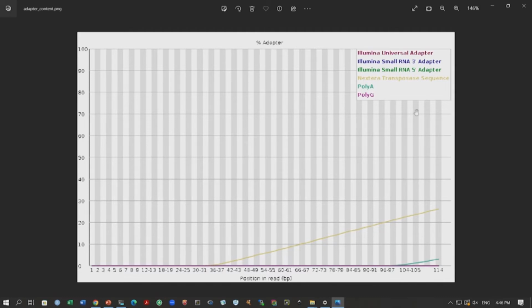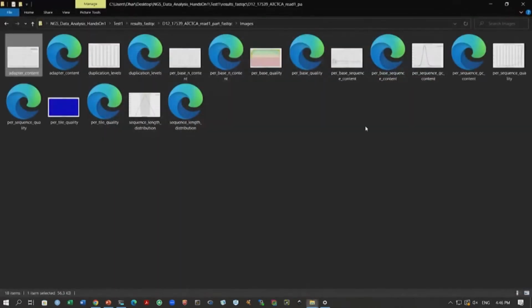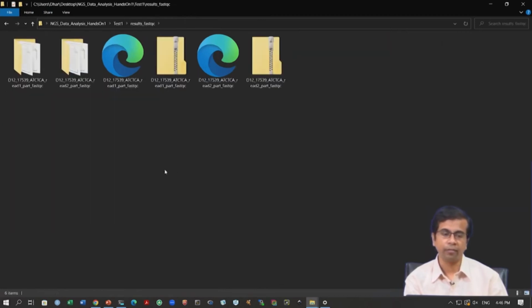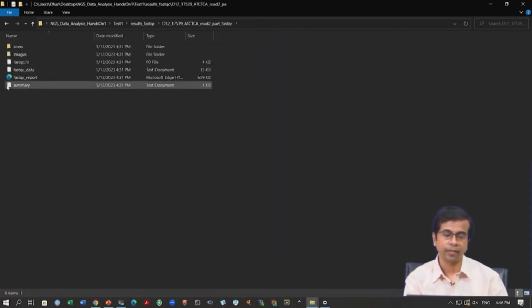Okay. So, once you have this adapter sequence, this means we need to remove adapters from the data. Okay. So, we need to do something called trimming. We have again discussed what trimming is, etc. Okay. So, this is for the read 1. Let us look at the read 2 data, right, what are the results.